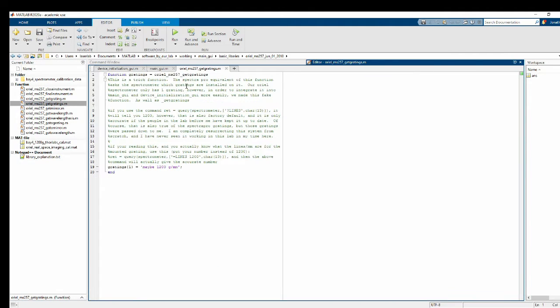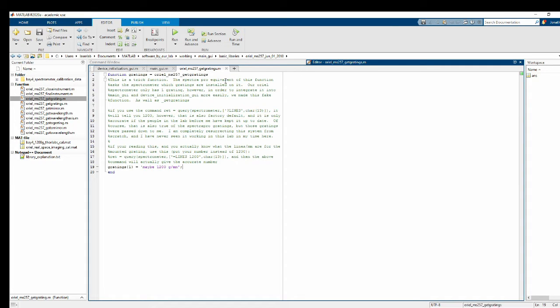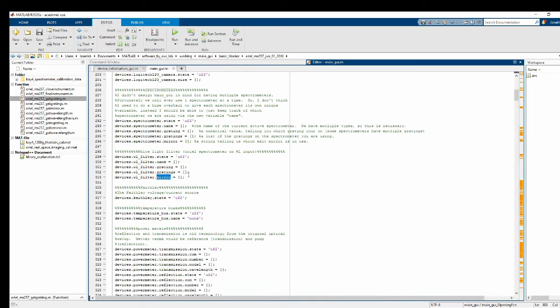Now in this case, our get gratings and our get grating are not particularly exciting because the Oriel only has one grating. So this is all just recorded inside our code. Unlike the SpectraPro, which actually can change gratings and things like that. Okay, so now I've put that into place.